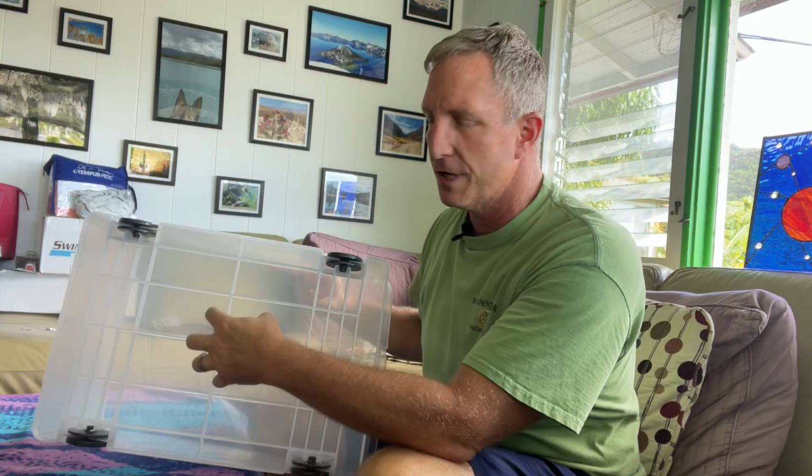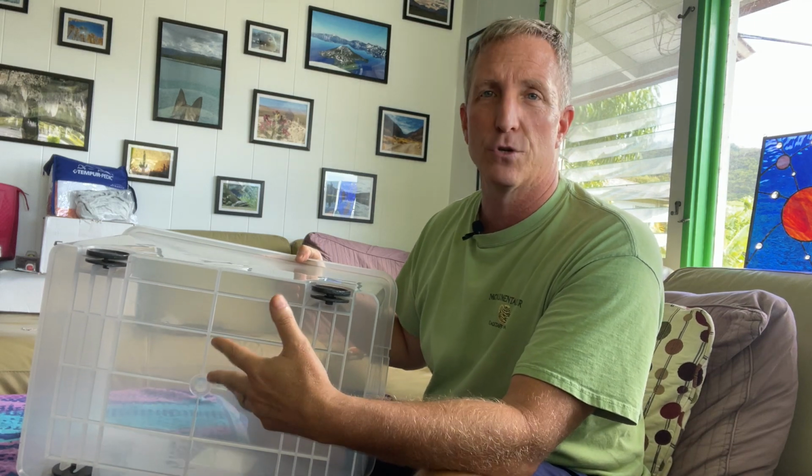The other thing, one of the big reasons why I have a problem with those ones, is because if you're using a filter that's, let's say, this size, you're only using a very small portion of it. And while you've got this huge filter, the benefit, if you look at the professional laminar flow hoods that cost $1,000 or more, is that they're using a huge thing. They've got a huge plenum area behind it, so that you get equal pressure all the way through. So here's a concept.